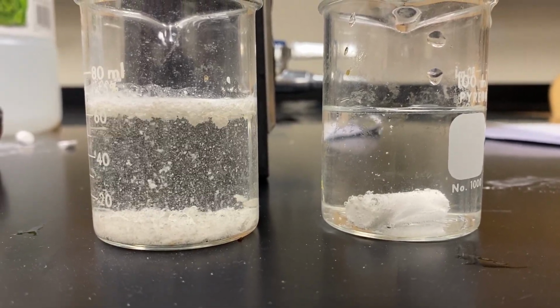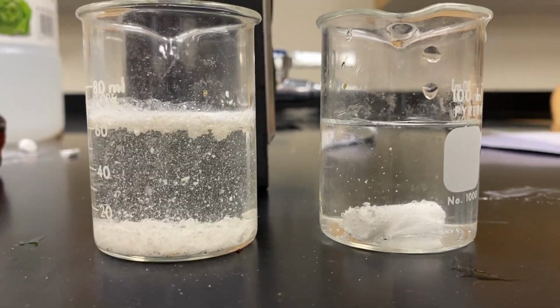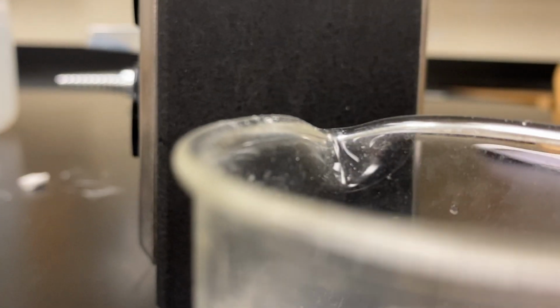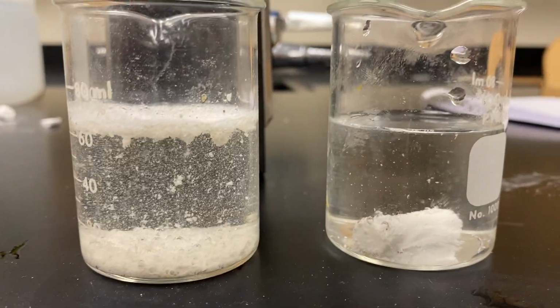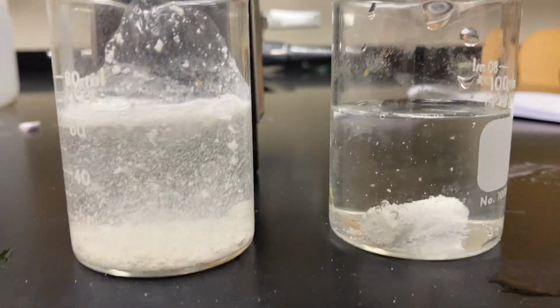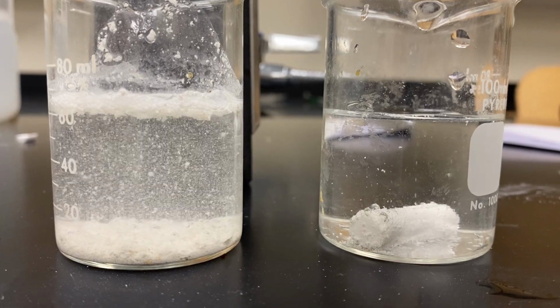The chalk in the vinegar we saw last time is very similar. It's bubbling, it's starting to flake a little bit, but this is super reactive. And you could probably also hear it. So let me see if you can hear it. Maybe, maybe not. All right, so make sure you have a drawing of what you see happening here, and let me give this a little shake. Agitate it a little bit. Almost looks like convection cycles.